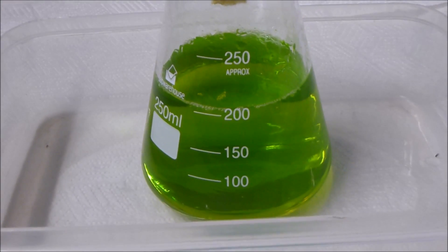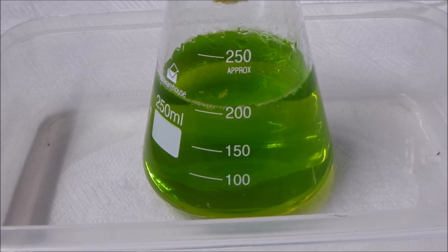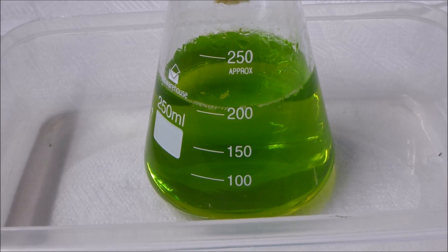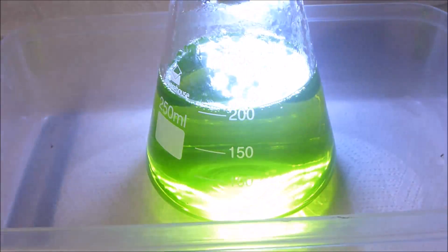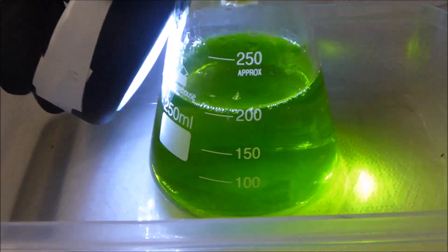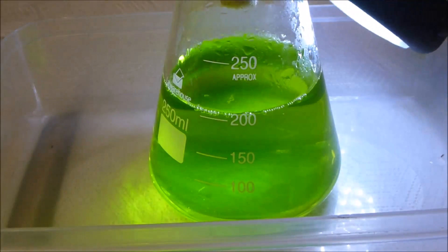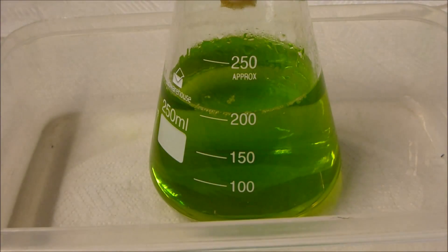What we have here is a very nice clear solution. That pretty much rounds off the whole concept of a simple cheap effective vacuum filter system.